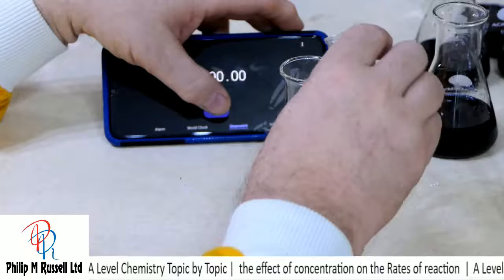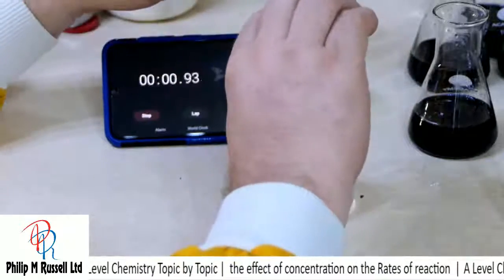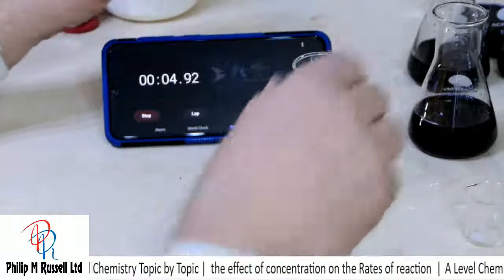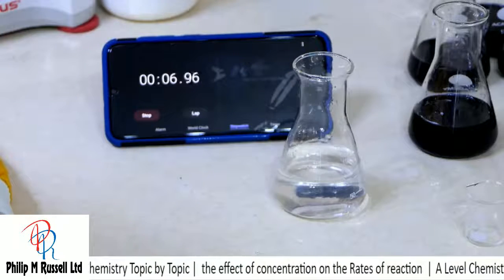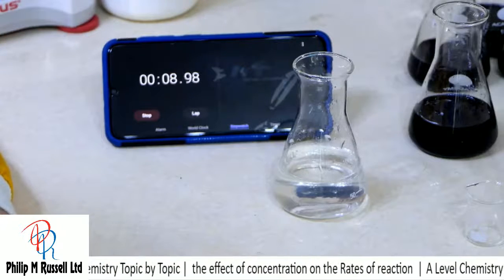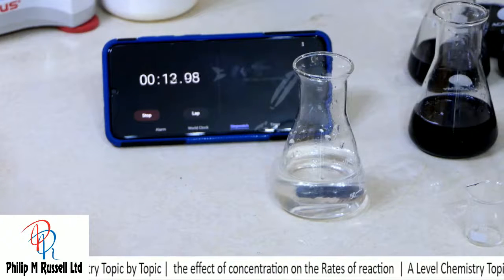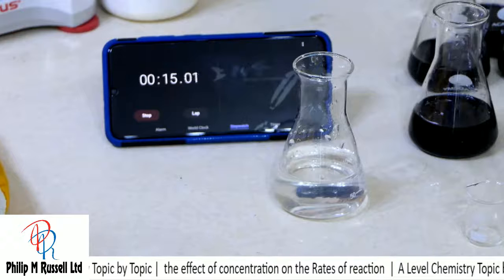And let's start the clock. With a bit of practice you can start timing this down to within a second or half a second or so.